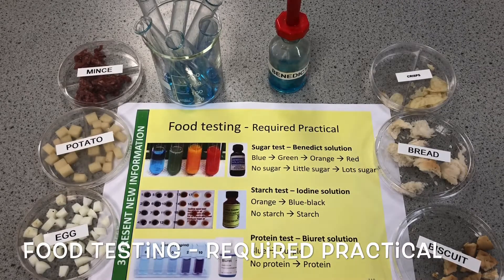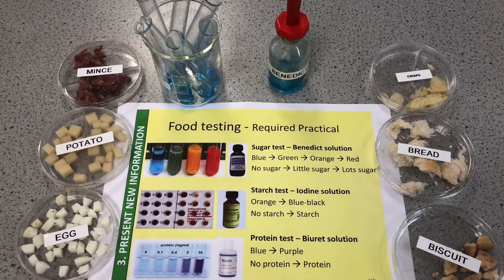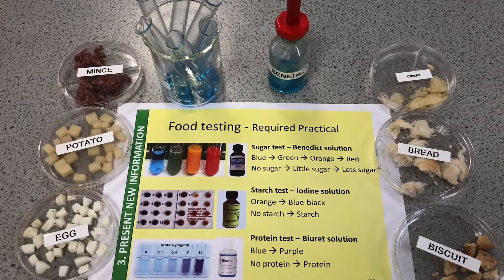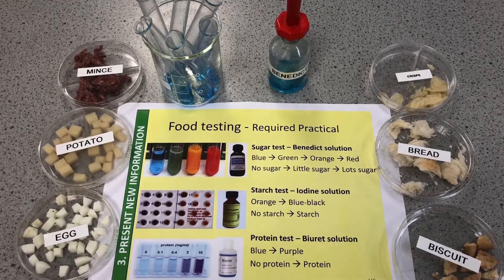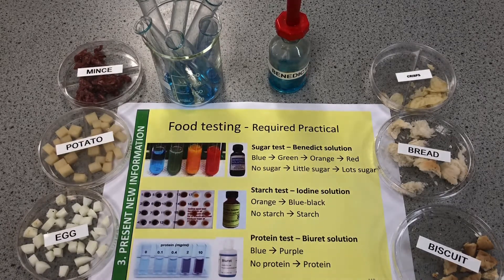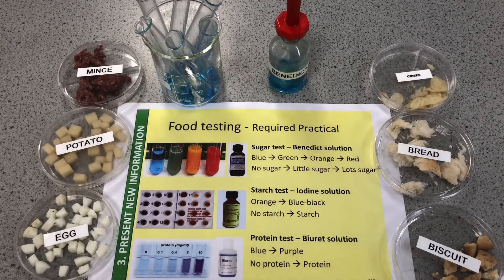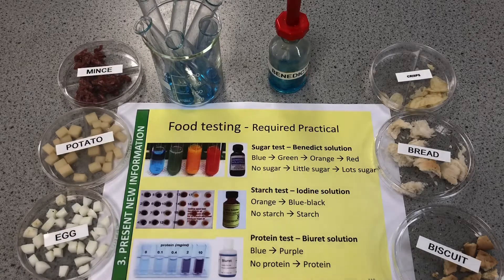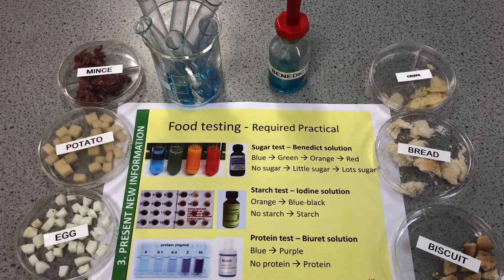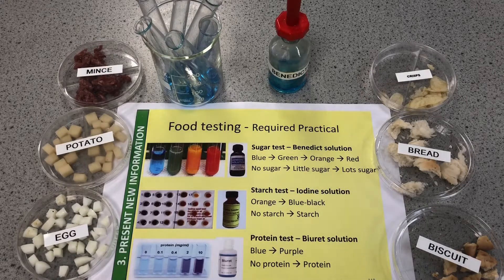Hello and welcome to a video for the required practical for food testing. This is in GCSE biology and we're also looking at it in the Year 8 topic human body. We've got a summary here of the three different food tests we need to do — the chemicals we need to use and the color changes we're looking for and what they mean.